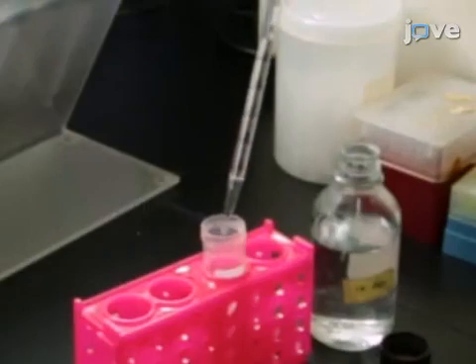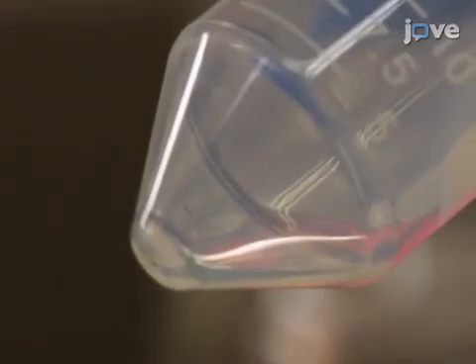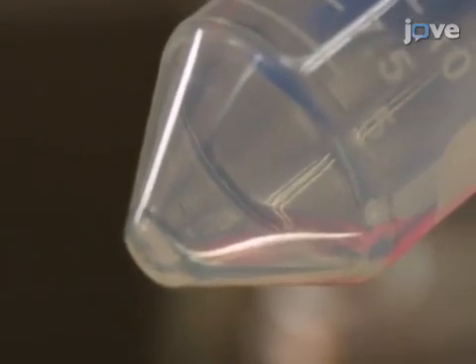Remove the residual lysis buffer with 10 milliliters of autoclaved PBS and re-suspend the pellet in 10 milliliters of RPMI 1640 medium.